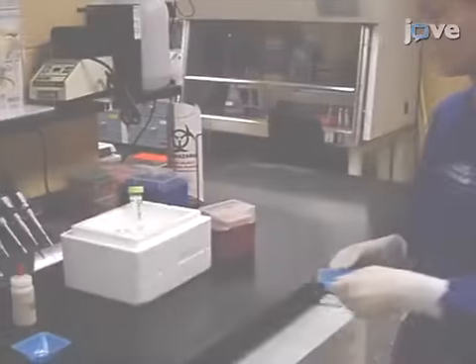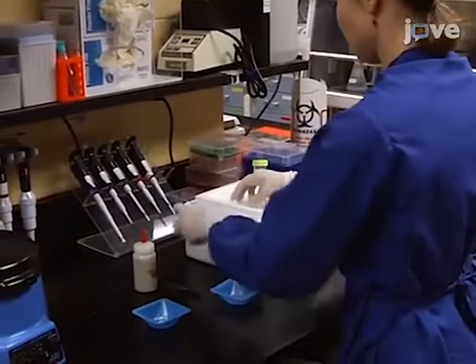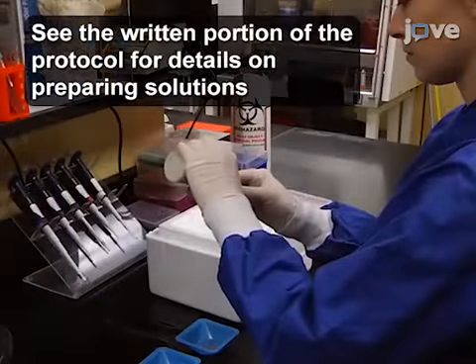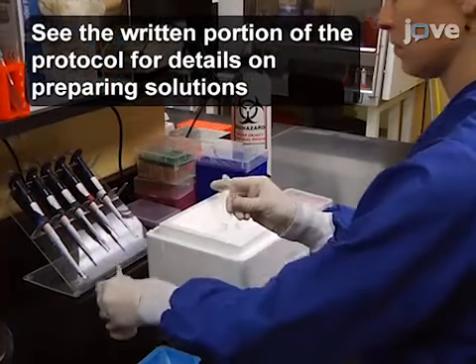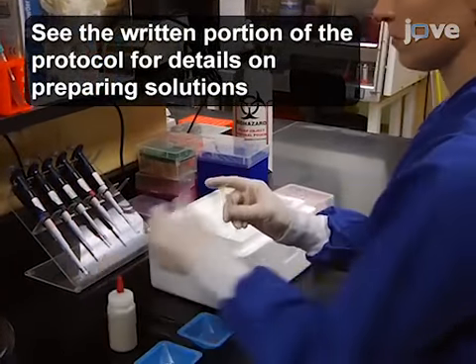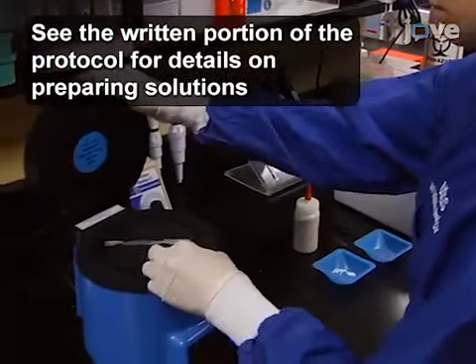After obtaining healthy, uninfected brain tissue from the species of interest, prepare a 10% weight per volume homogenate in lysis buffer using a bead mill or mortar and pestle homogenization.